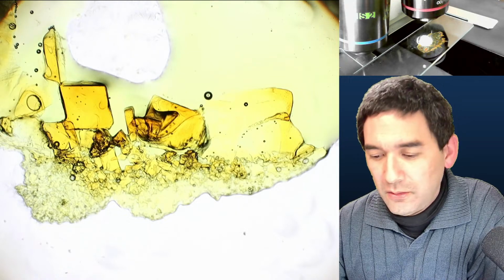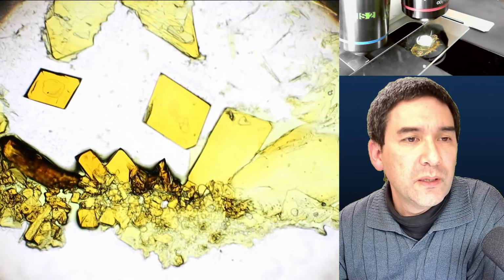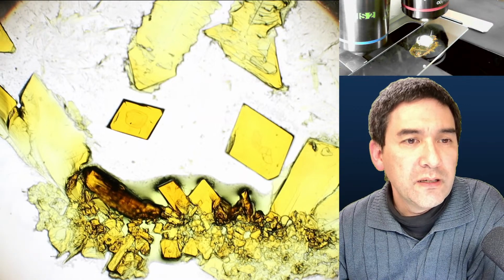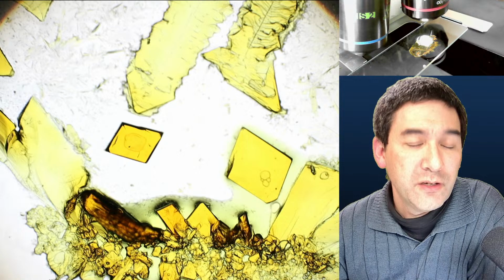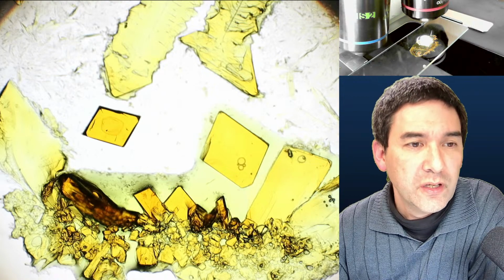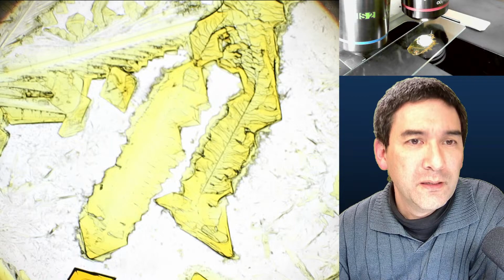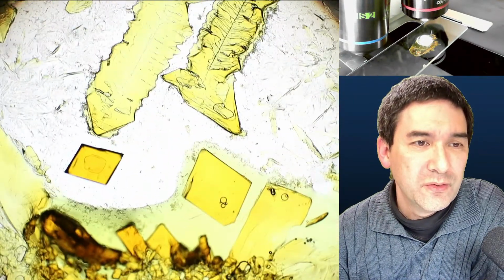Okay, so just what I'm going to do is the following. Look, there's a little bit of recrystallization happening here. Just like for my other slides, I've bought some antique slides. Last week I showed them all to you, and now I'm making individual videos. I'm going to also make individual videos for those crystals here. Maybe I'm going to pick the nicer ones a little bit, and then I'm able to make separate short videos concerning those crystals.